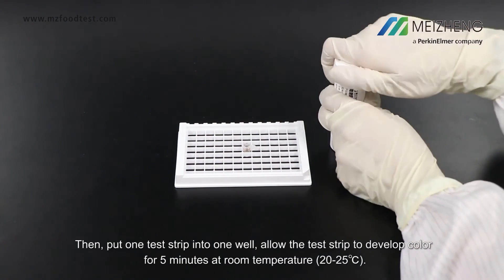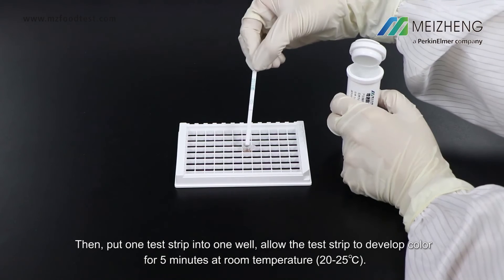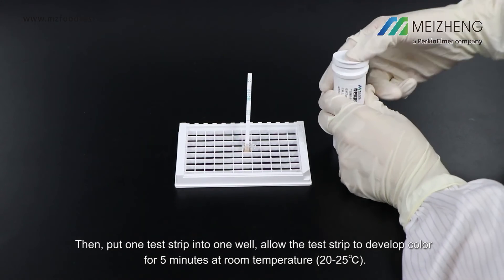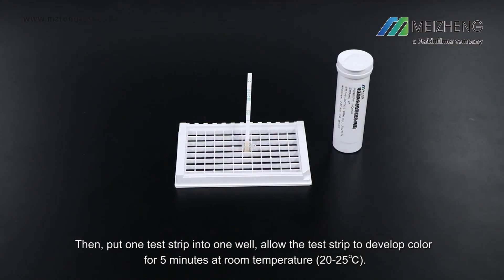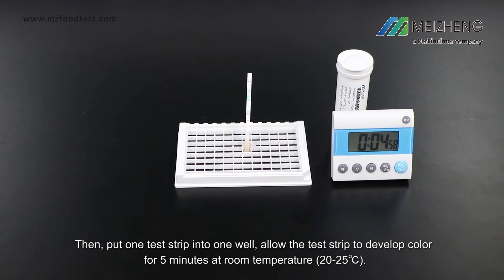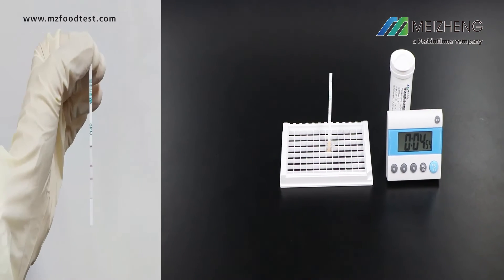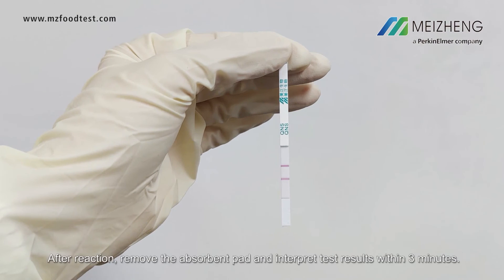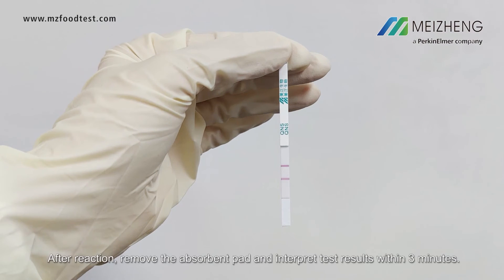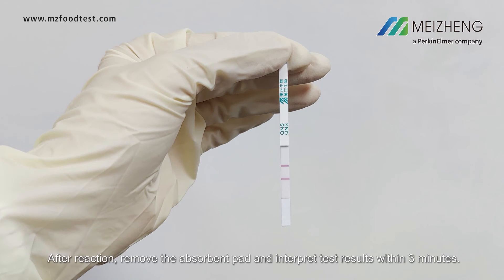Then put one test strip into one well and allow the test strip to develop color for 5 minutes at room temperature. After reaction, remove the absorbent pad and interpret test results within 3 minutes.